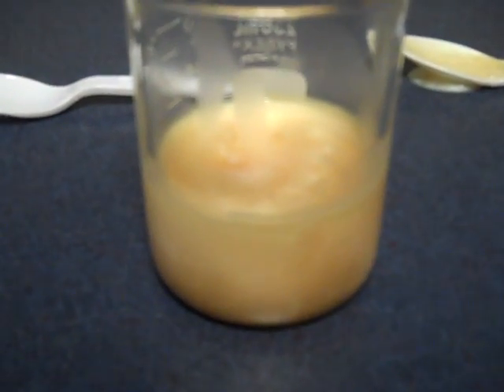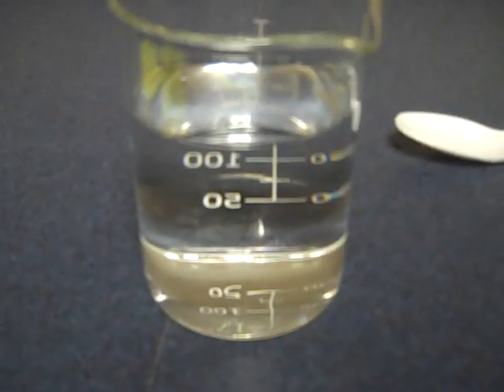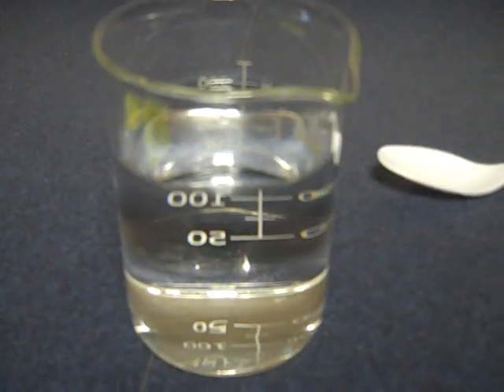This beaker is a colloid — it also scatters light but it does not have large particles that sink to the bottom. The third beaker is a solution.